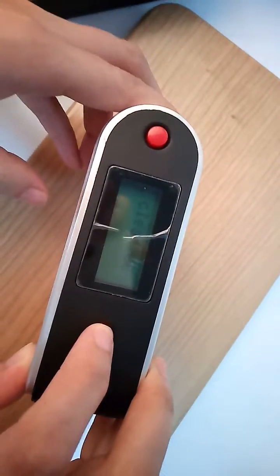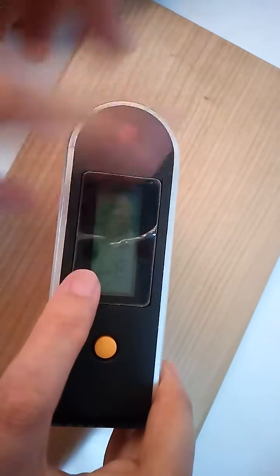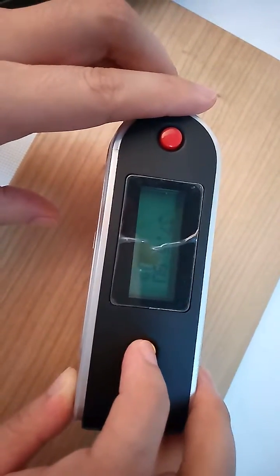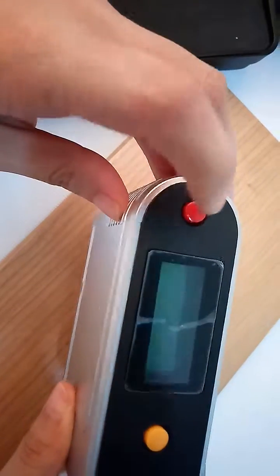Clear, clear all data. Yes. Now from the first beginning — first time, second time. Power off.